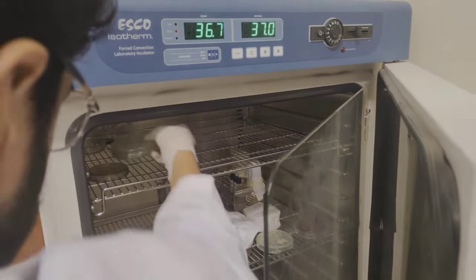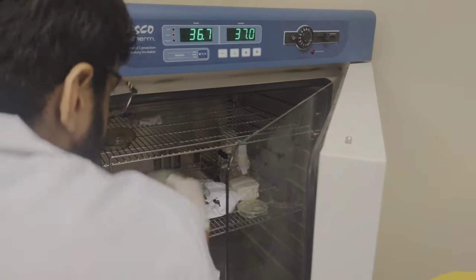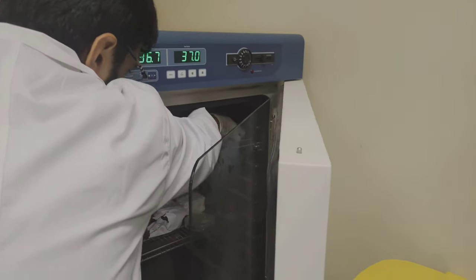Now we will place our plates in incubator at 37 degree Celsius temperature for 24 hours.